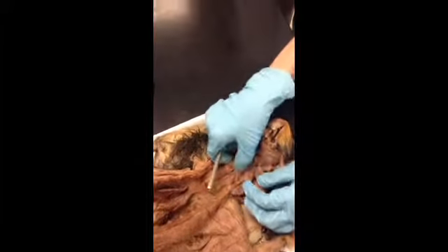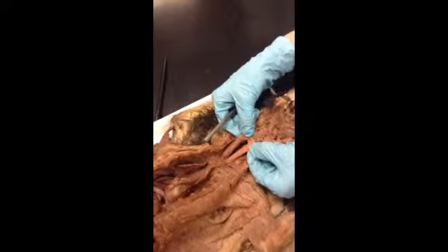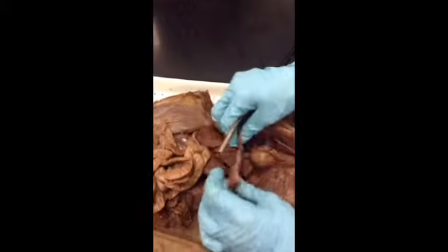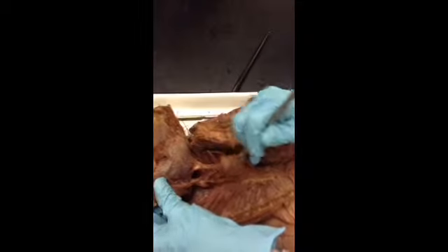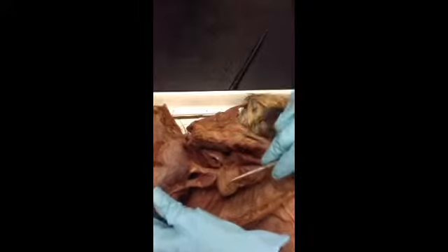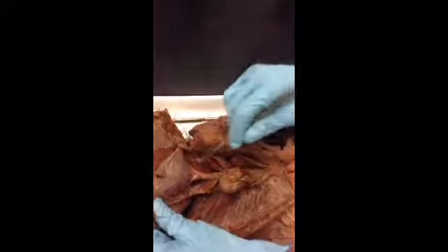Put that back together. If we look behind the trachea, we find the esophagus. Okay. We come down here. It wants you to look for the phrenic nerves. So this is our diaphragm. We pull our diaphragm up. The phrenic nerves are these long threads right here. They go right into the diaphragm. Those are the nerves that innervate the diaphragm. And there should be one on each side, in theory, but there isn't one on this side anymore.